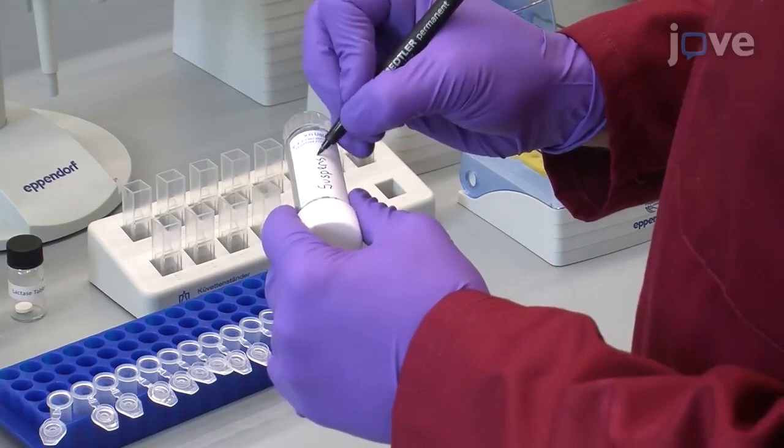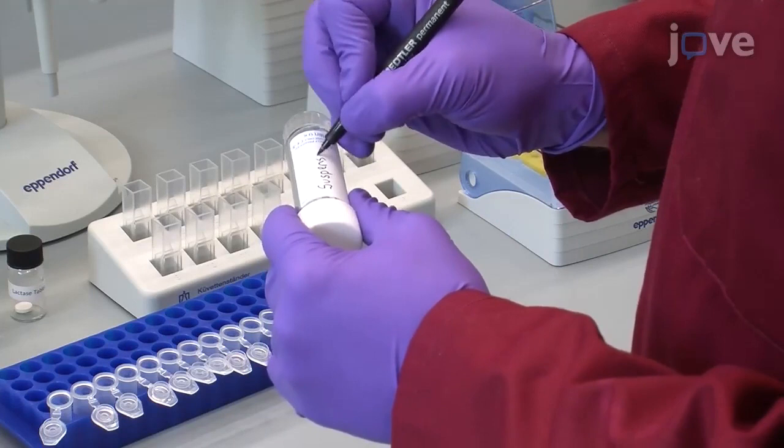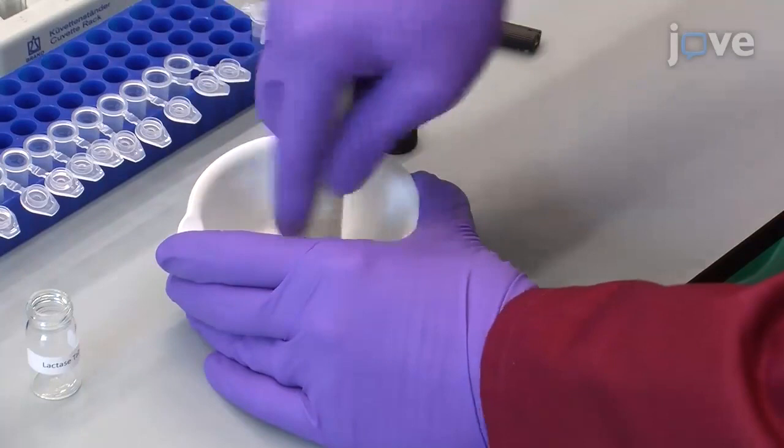To begin the protocol, label a 15-milliliter tube suspension. Crush one lactase tablet containing 200 milligrams of enzyme into an even powder using a mortar and pestle.